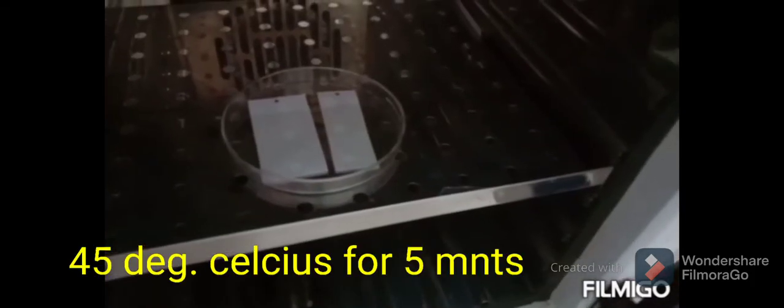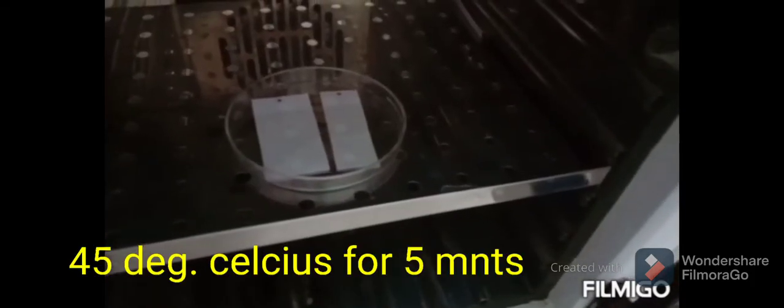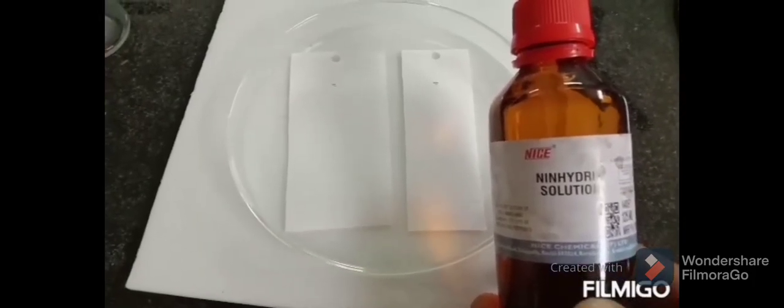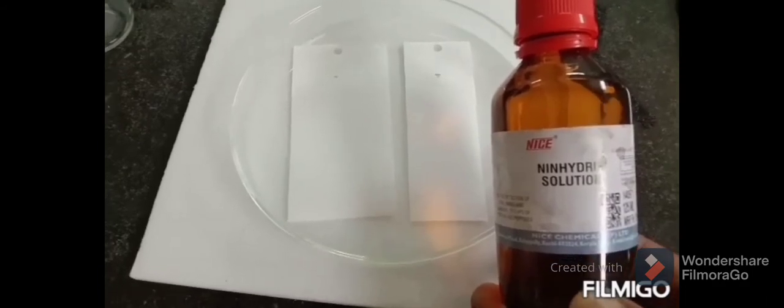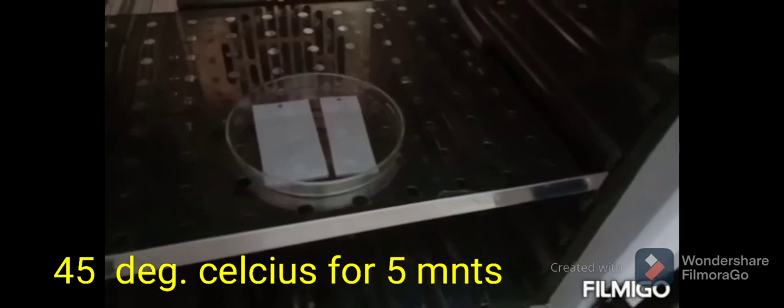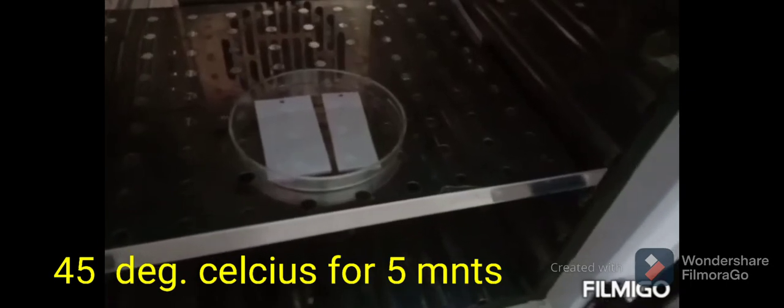The paper is allowed to dry in air or in an oven at 45°C. Afterwards, the solutes are visualized by spraying with one percent ninhydrin solution for detection of amino acids, and the paper is dried again in the oven at 45°C. One percent ninhydrin gives a purple color for all amino acids except proline, which gives a yellow color.